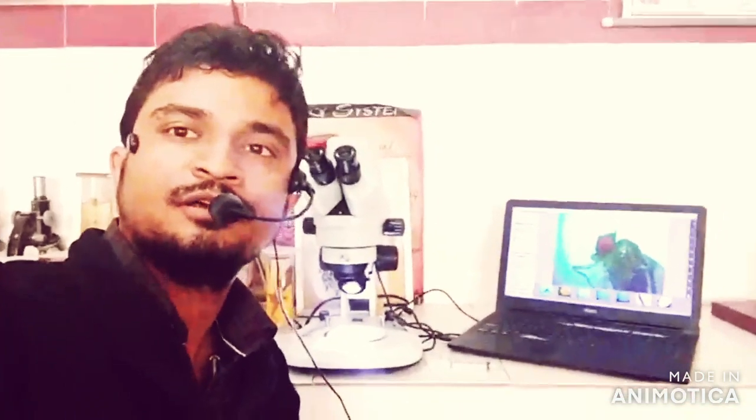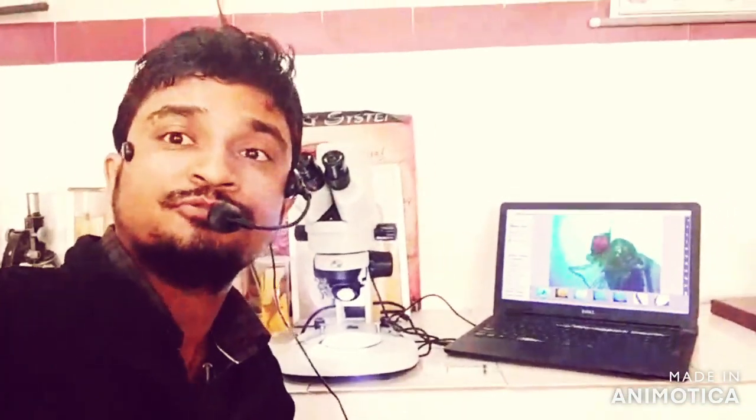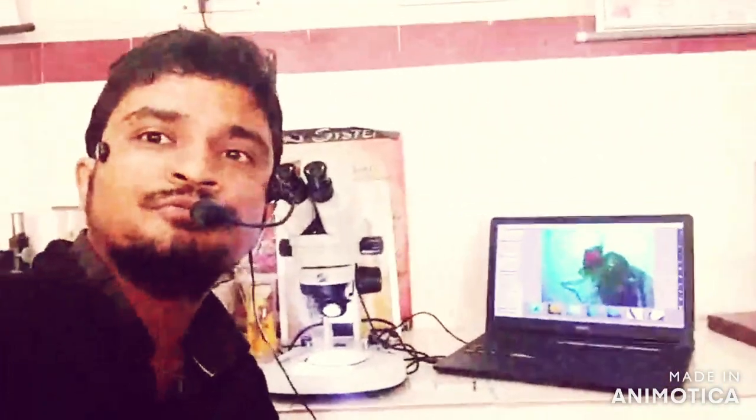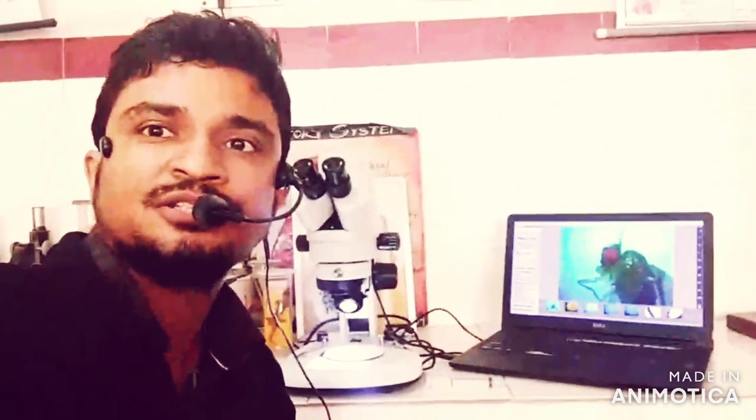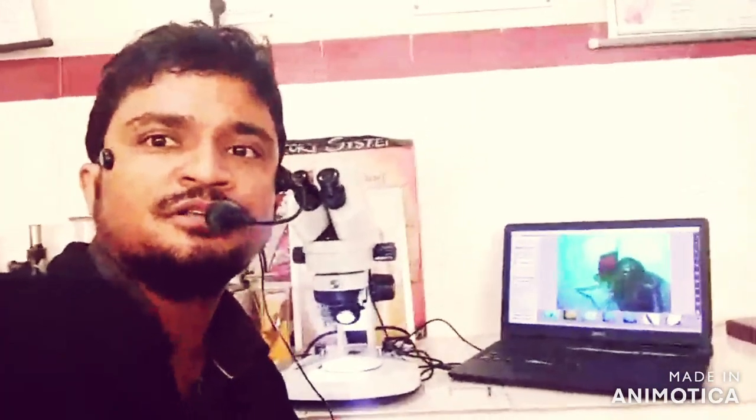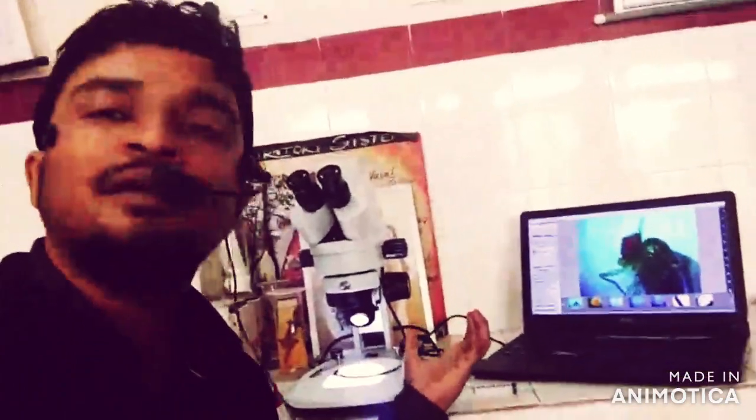Hello, good morning friends. Today we are going to observe the Drosophila external morphology using a stereo binocular digital microscope. We know that Drosophila is known as the Cinderella of genetics and has been extensively studied for genetic research. To study the morphology, you need simply one digital microscope and you need to install the application for it, and you can project it and focus on different parts of the Drosophila.